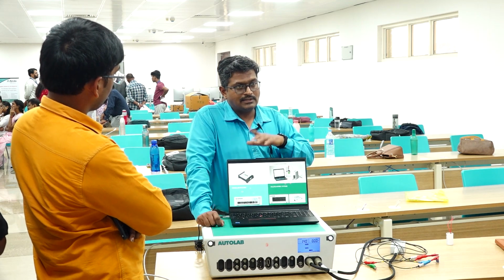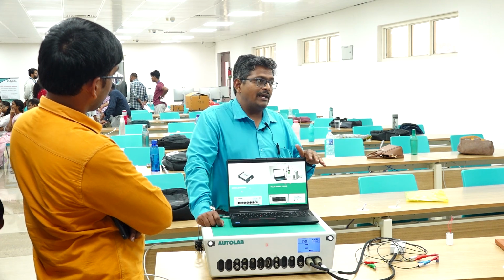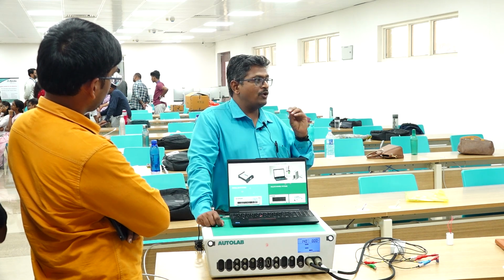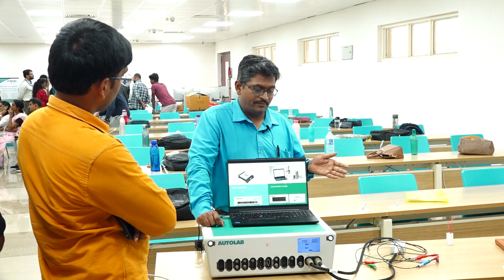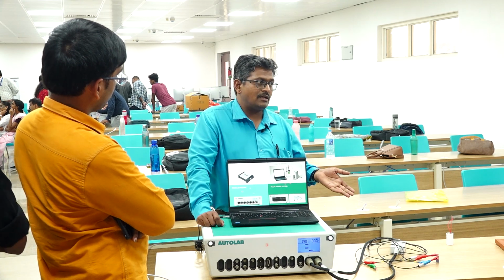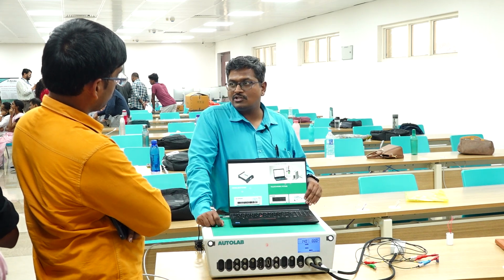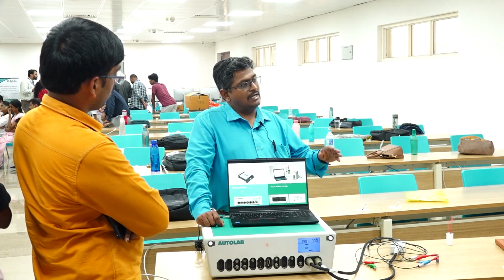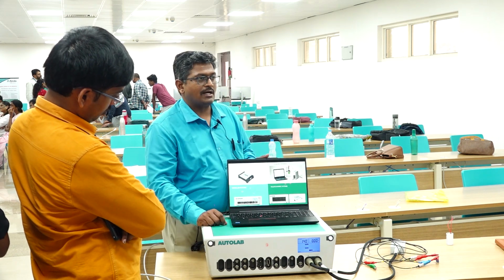In the modular setup, it is the same single channel equipment, with one potentiostat, galvanostat, but you can connect n number of modules. In the same equipment, you can measure EIS, you can do RRDE experiments, and you can do EQCM experiments. Many modules you can connect to the same equipment, so you need not buy different equipment. In the multi-channel equipment, you can have more potentiostat, galvanostat channels along with the modules, or only potentiostat, galvanostat modules. With our Metrohm Autolab system, you can go up to 12 channels. Either you can work with 12 potentiostat, galvanostat channels, or 6 potentiostat, galvanostat with 6 impedance modules. Whenever you add a module, it also occupies one channel slot.